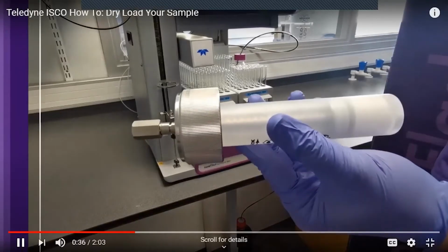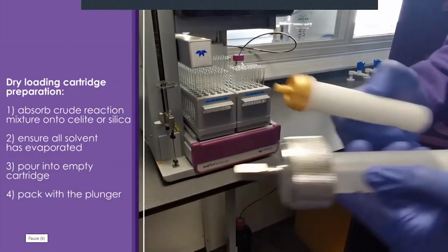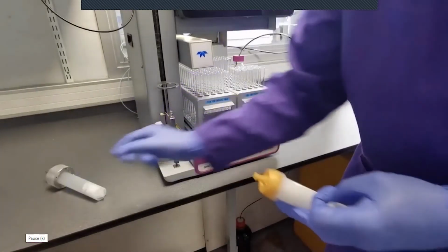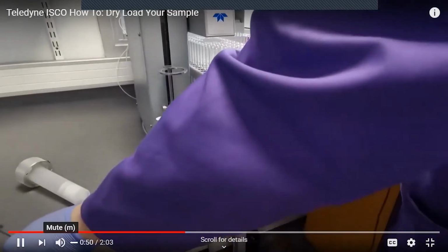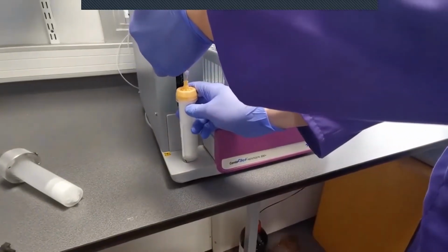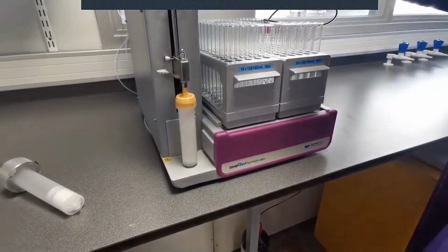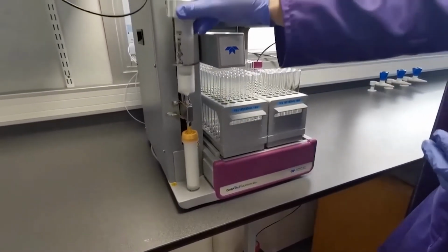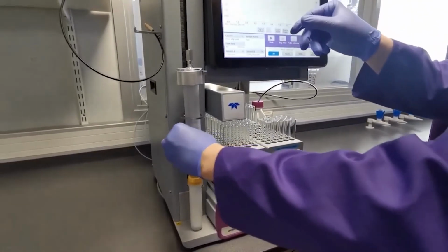So now that we've prepared our dry loading cartridge, all we need to do is load this with our column onto the machine, and we're ready to run our purification. So let's give that a go. First, we need to remove the bypass tube. We then lift the valve up and insert the column. The machine will detect that this is a 24-gram silica cartridge. We then take the dry loading cartridge and load this onto the top of the injection valve and screw this into place.